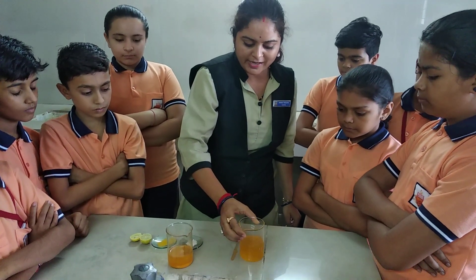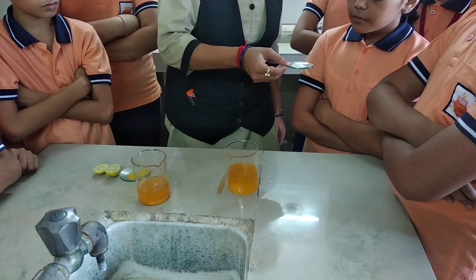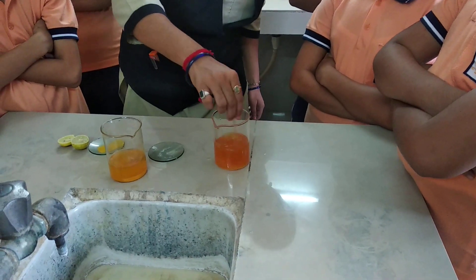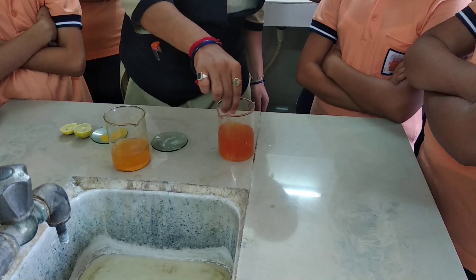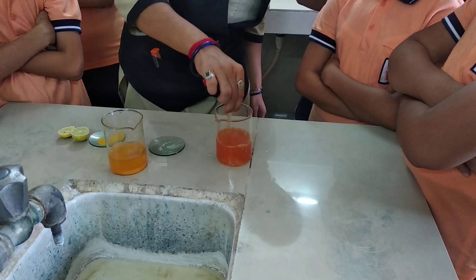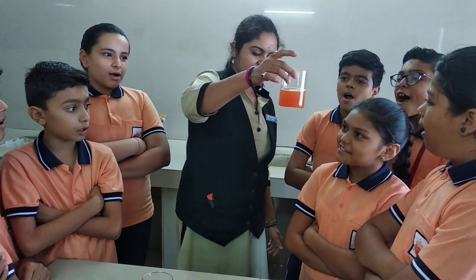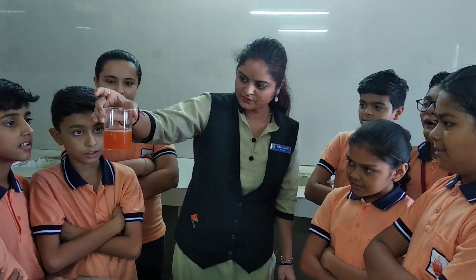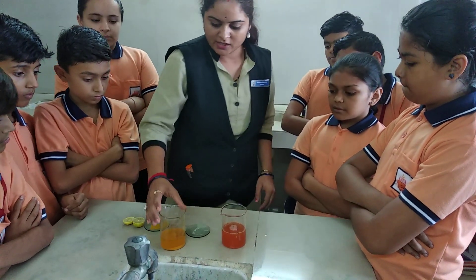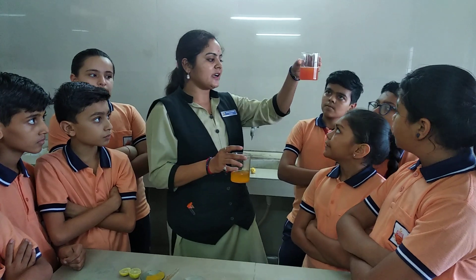Now we will add some detergent powder in the beaker and see what happens next. Now you can see the change in color — it will get darker and darker. This was our original mixture, and after adding the detergent we are having a red colored mixture.